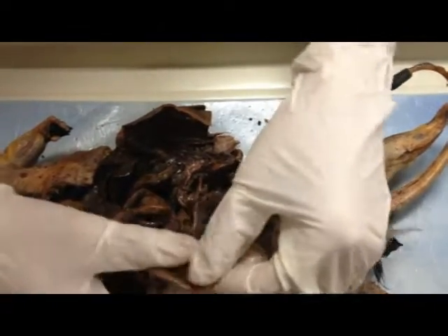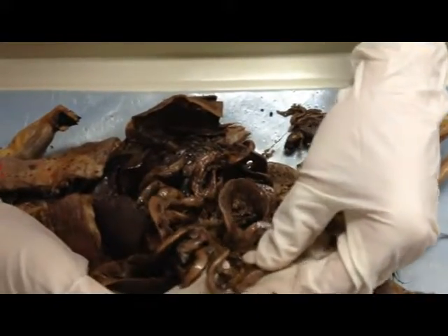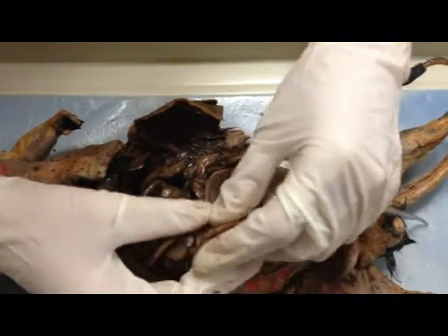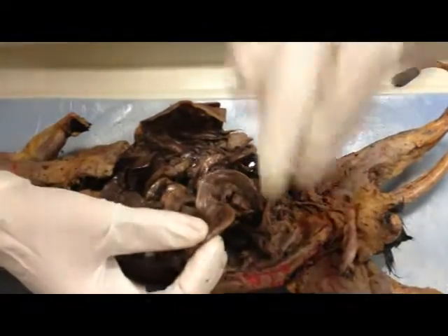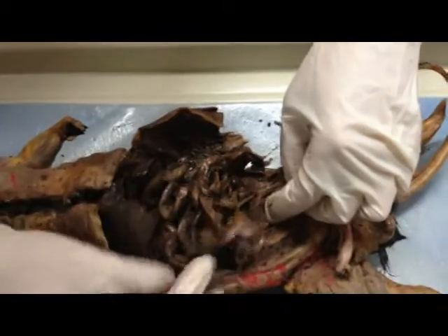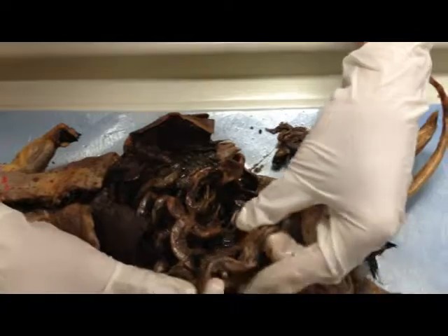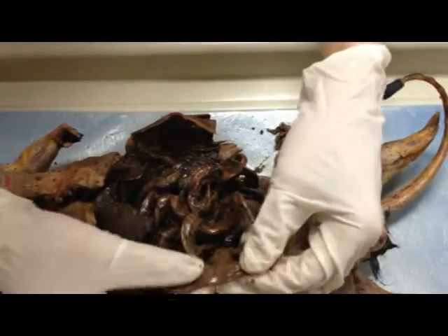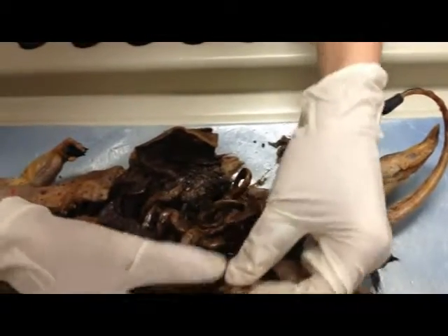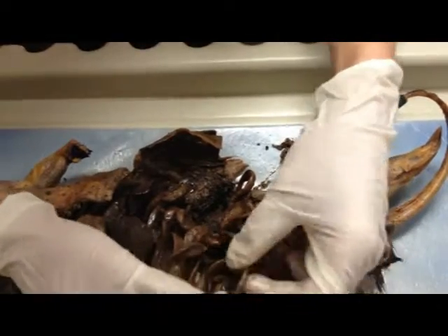Then it gets a little bit darker again. So this one gets a little bit darker — now this is going to be the ileum. It's a little bit darker, so it goes from really dark to very light to a middle color — a tint that's a little bit darker, but not as dark as the duodenum. As it gets flat and bigger, that's still the ileum.